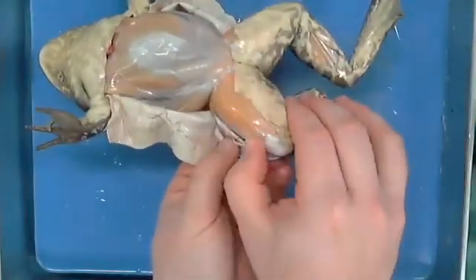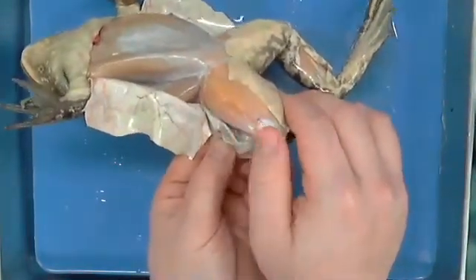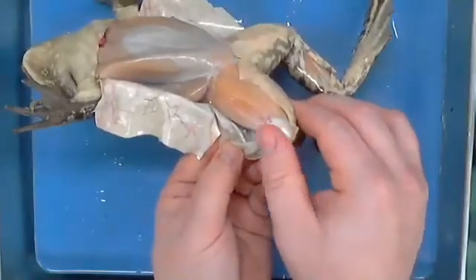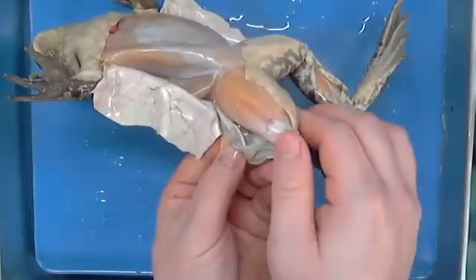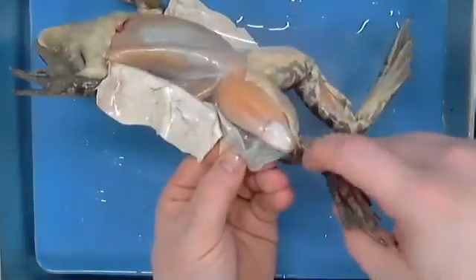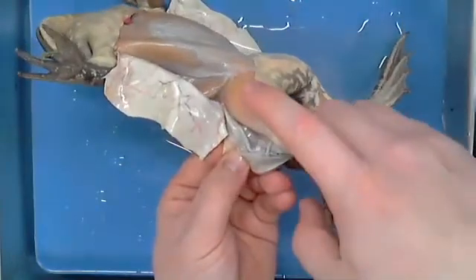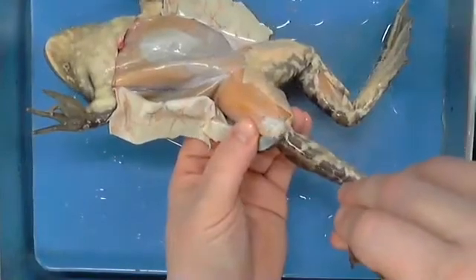And then on the outside, you notice that he has got this musculature, which is his extensor. And of course, notice how it wraps over what you would call a kneecap. We call this just basically a joint for him, but you would call this a kneecap. That's how it works. In other words, this muscle comes over the knee into this next bone. And so as it tightens, it pulls the leg this way and actually extends.